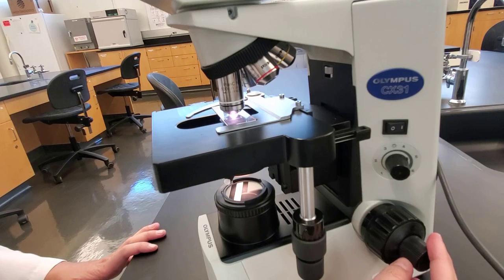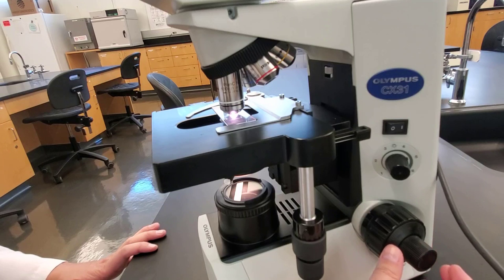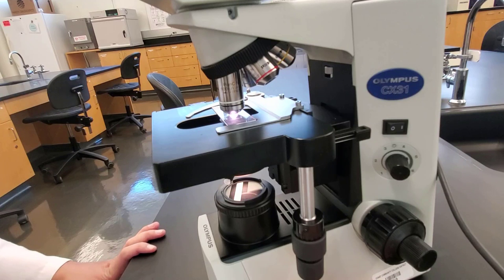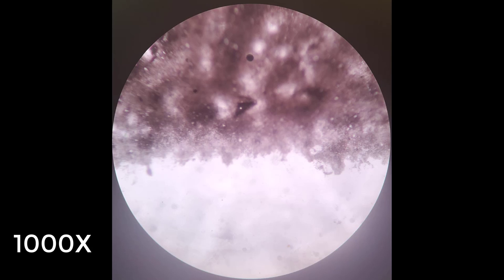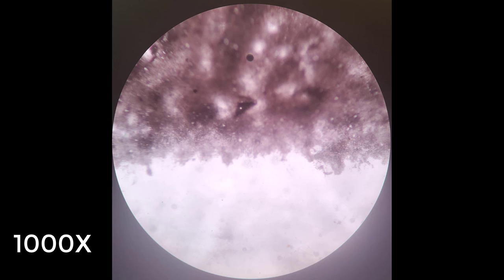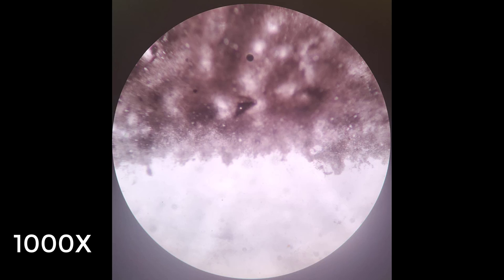I rotate the 100x objective using the revolving nosepiece and when it clicks into place, I look in the eyepiece and use only the fine focus — I am so close to the slide. These microscopes are parfocal: they stay roughly in focus as we go up in magnification, which is why we only need the fine focus. At 1,000x total magnification, I can't even see the whole middle part of the E; I see only a very small portion with even more detail.